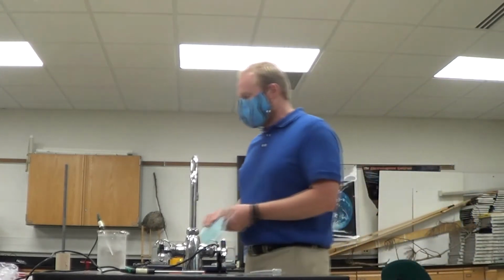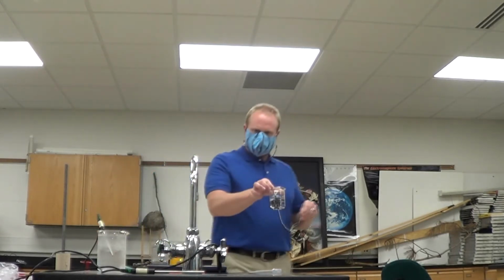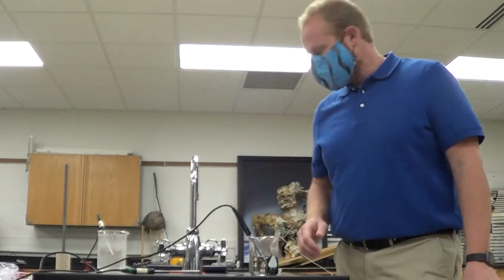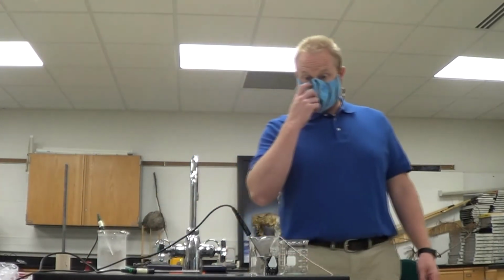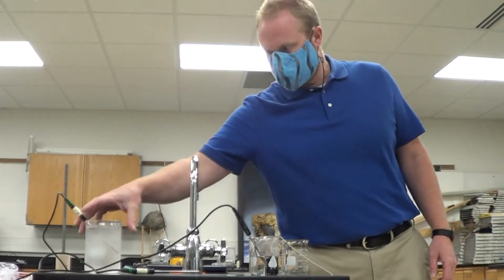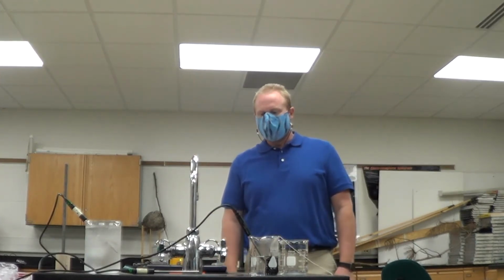All right, so in our properties of water, if we take a look at station number 9. Station number 9, I have some material set up for us. So we have some beakers. I have a beaker of hot water and some hot metal in there. And I have a beaker of cold water, and the temperatures are displayed up on the screen.